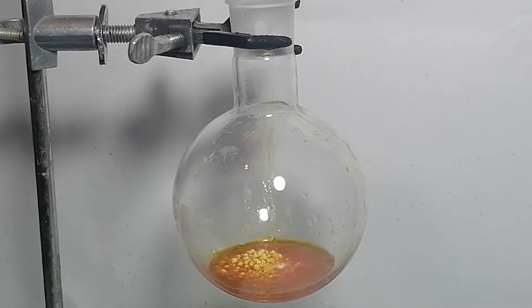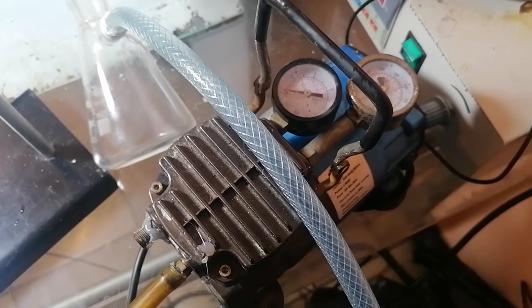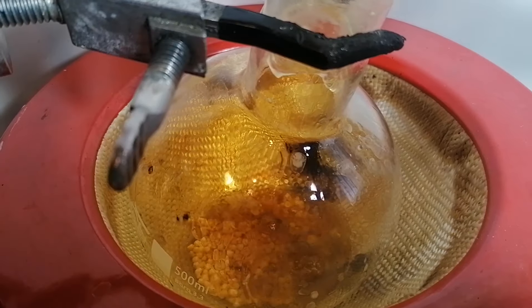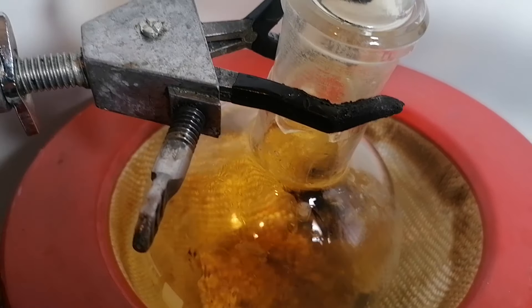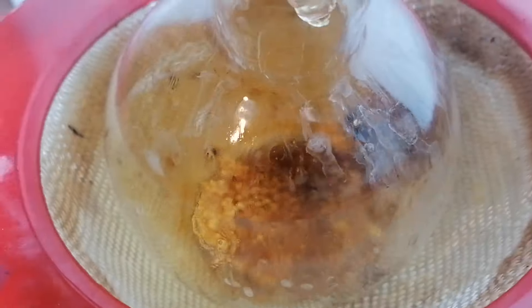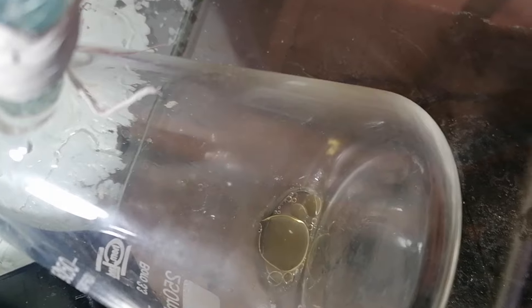Here you can see me adding some calcium chloride, which will hopefully dry the organic layer. Here's me turning on the vacuum pump. After heating it some, for some reason everything started bubbling again and a bunch of nitrogen dioxide started appearing. I have a theory it's benzyl nitrate or nitrite decomposing due to the heat, which means I think we're completing the reaction, however this just added a bunch of side products to our benzaldehyde. Here's a shot of the benzaldehyde very slowly dripping into the collection flask.